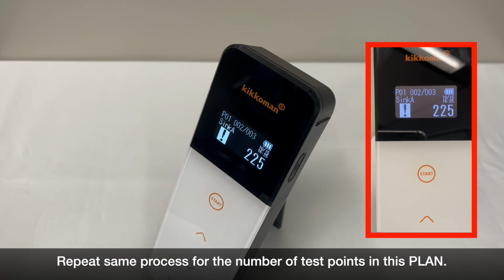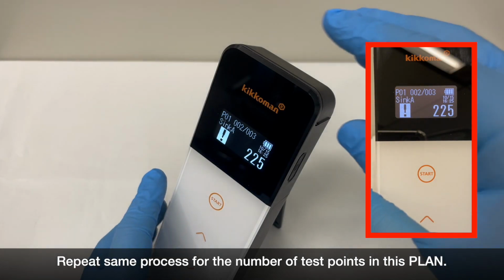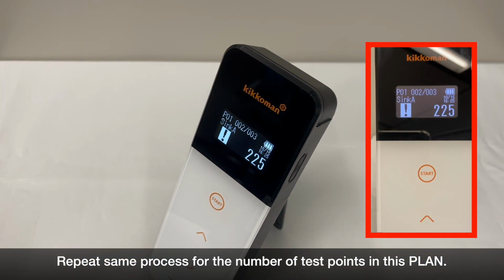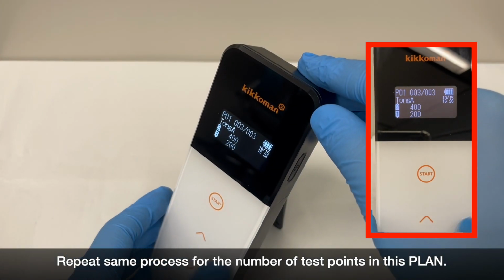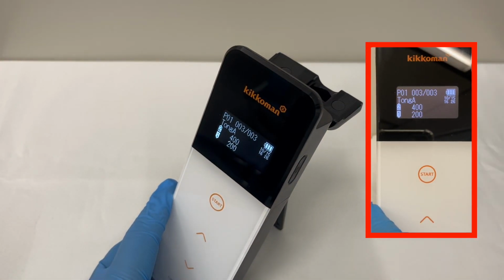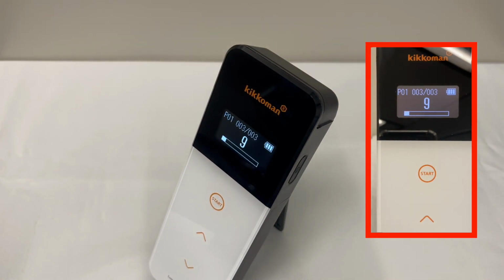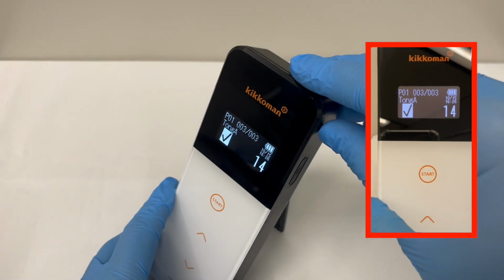This time, an exclamation mark is displayed, which means caution. Repeat this process for the number of test points you set in this plan. This time, a check mark is displayed, which means pass.